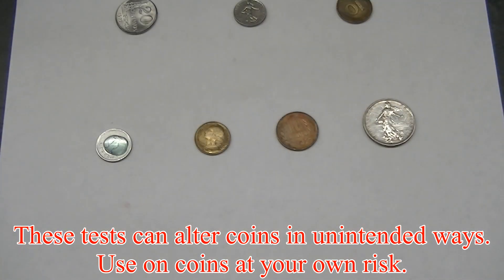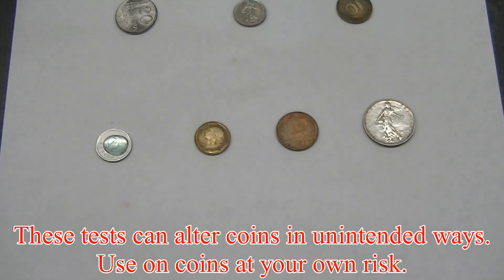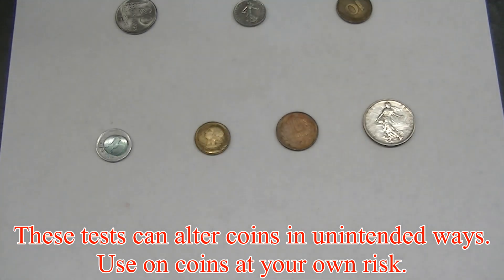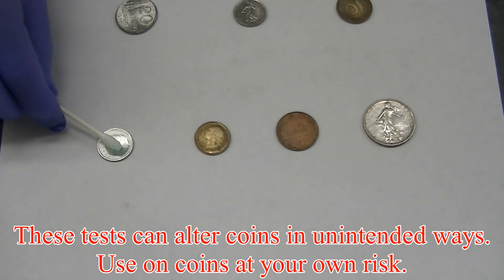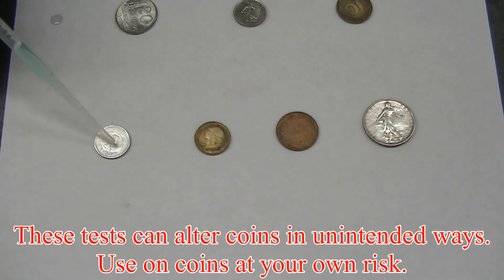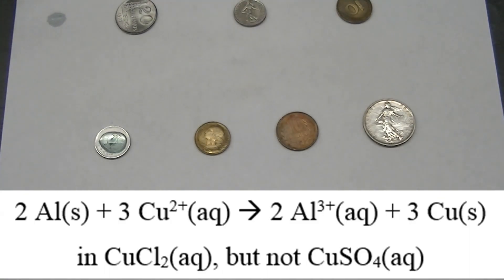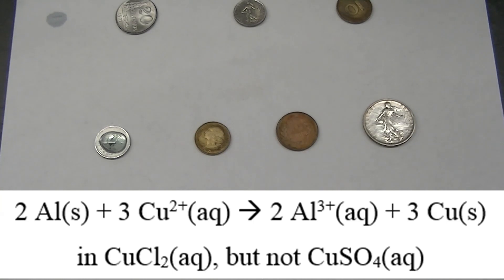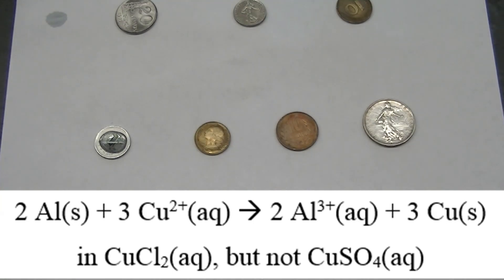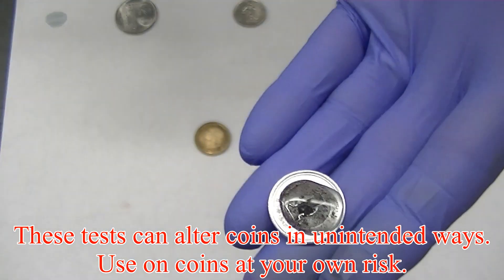Finally, we'll try the dissolved copper test on this small silvery colored coin. A solution of acidified copper sulfate seems to have no effect on this coin. When we try a solution of copper chloride instead, we see the formation of some solid product, indicating the formation of solid copper — so this coin is probably made of aluminum metal.